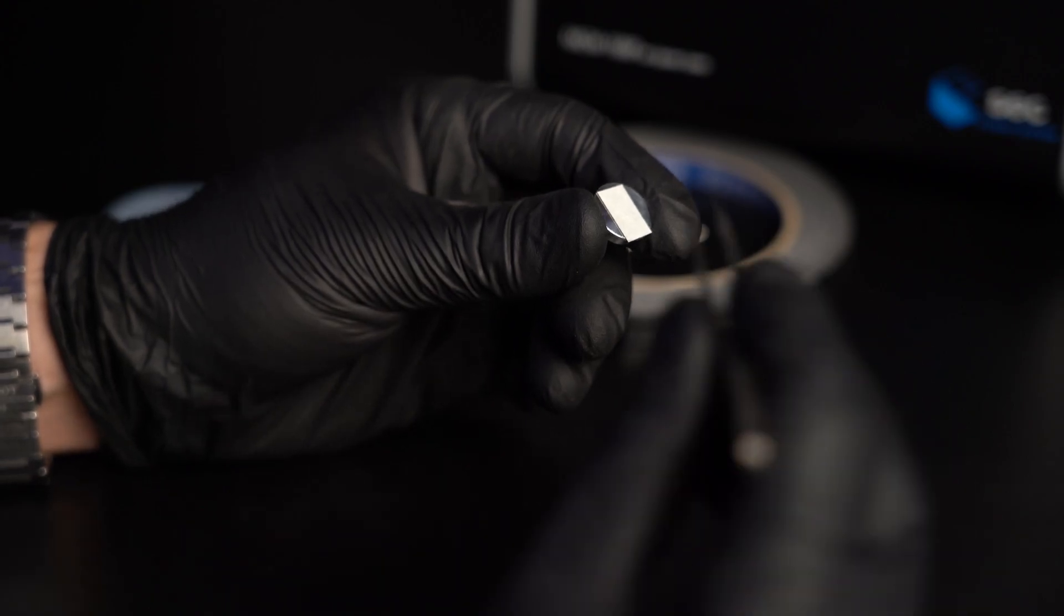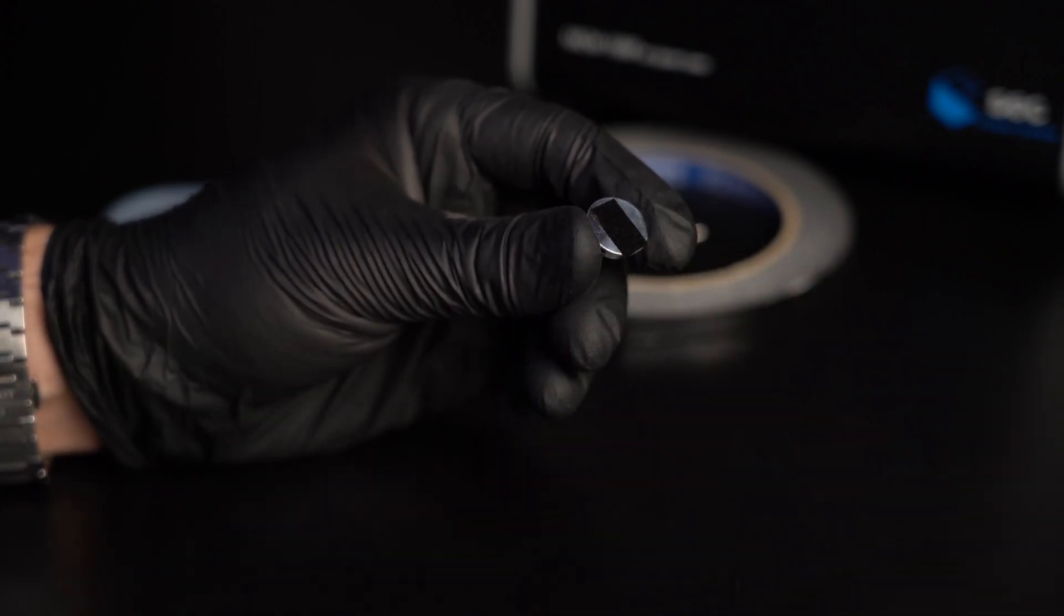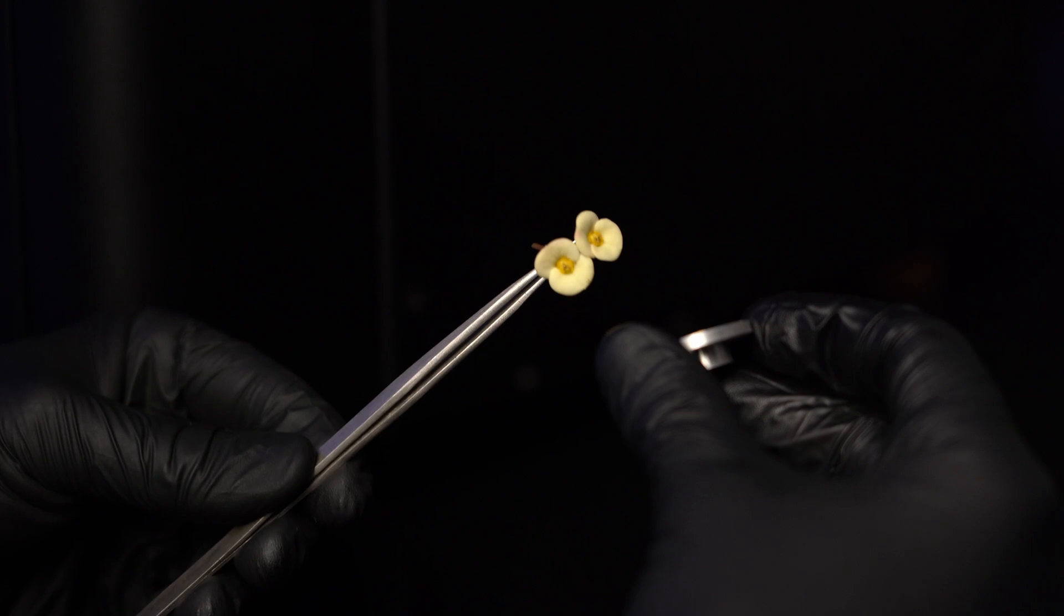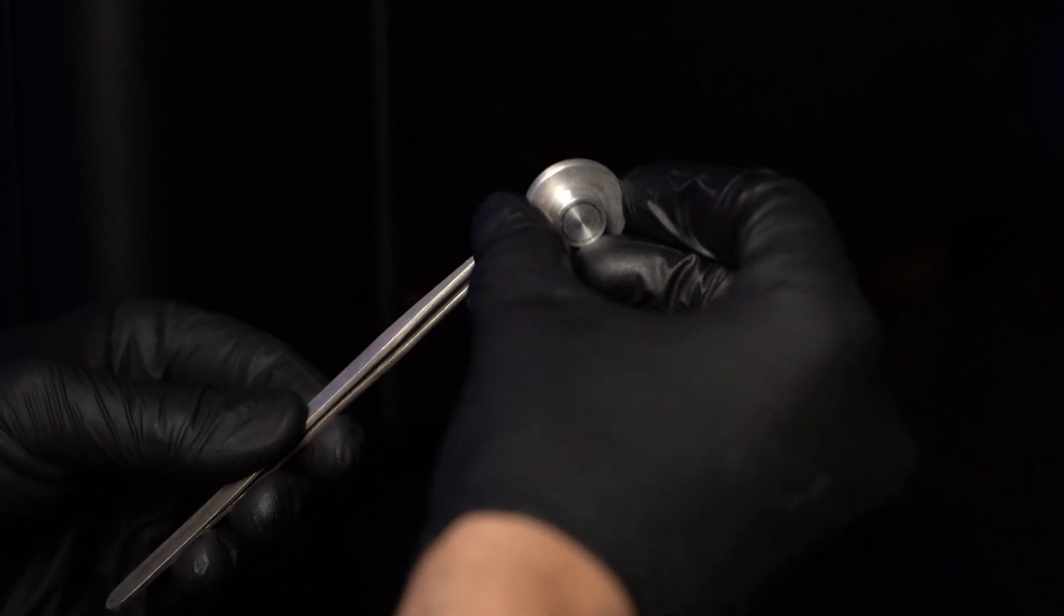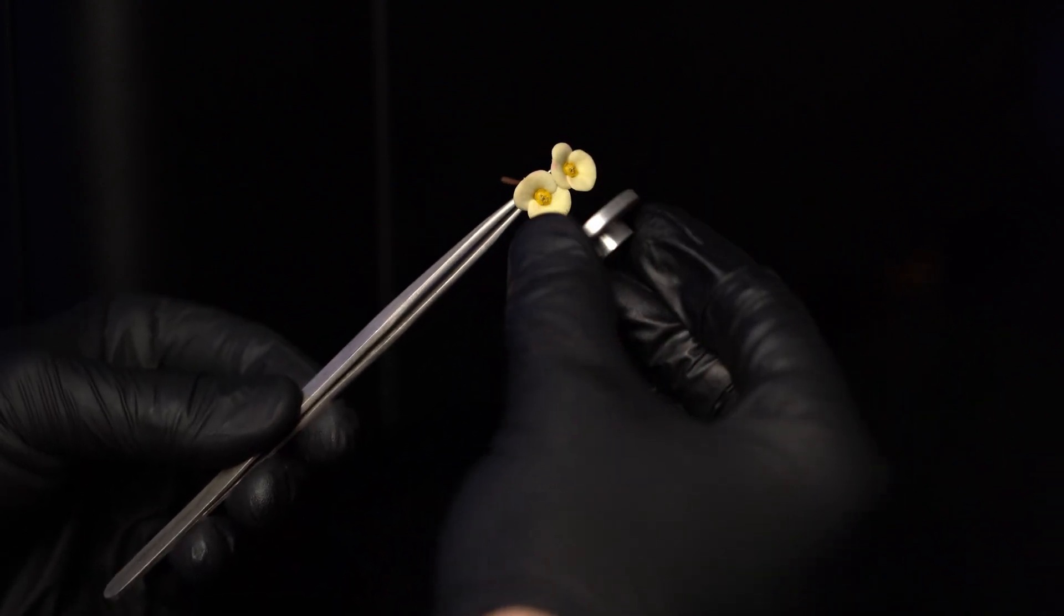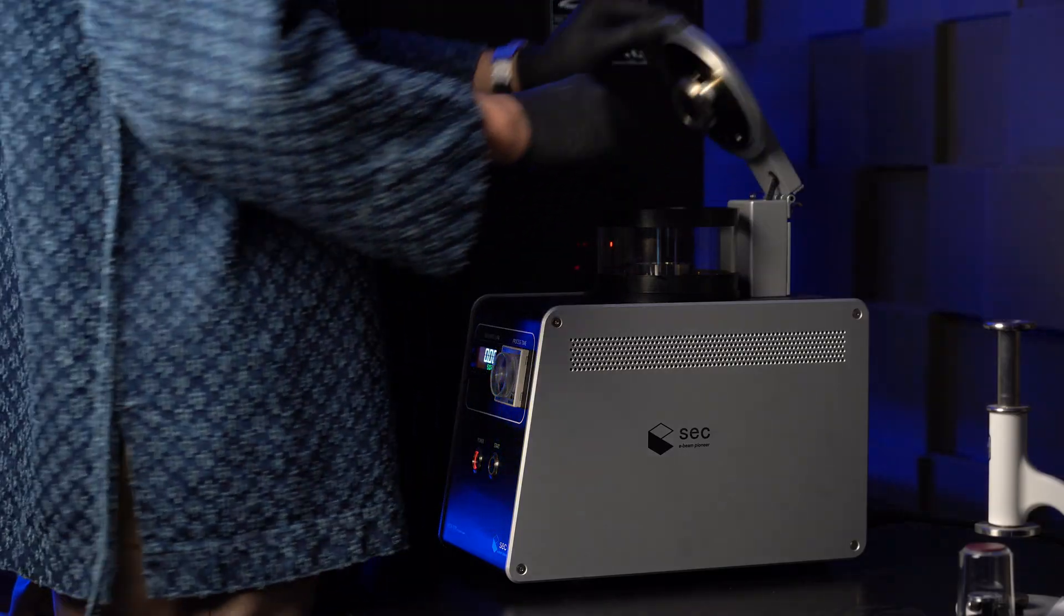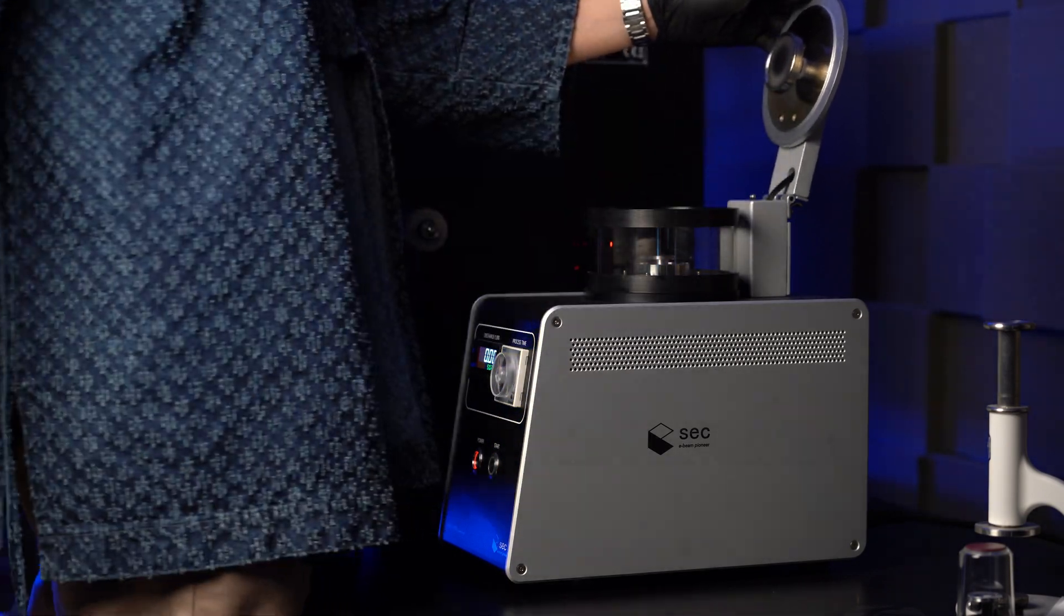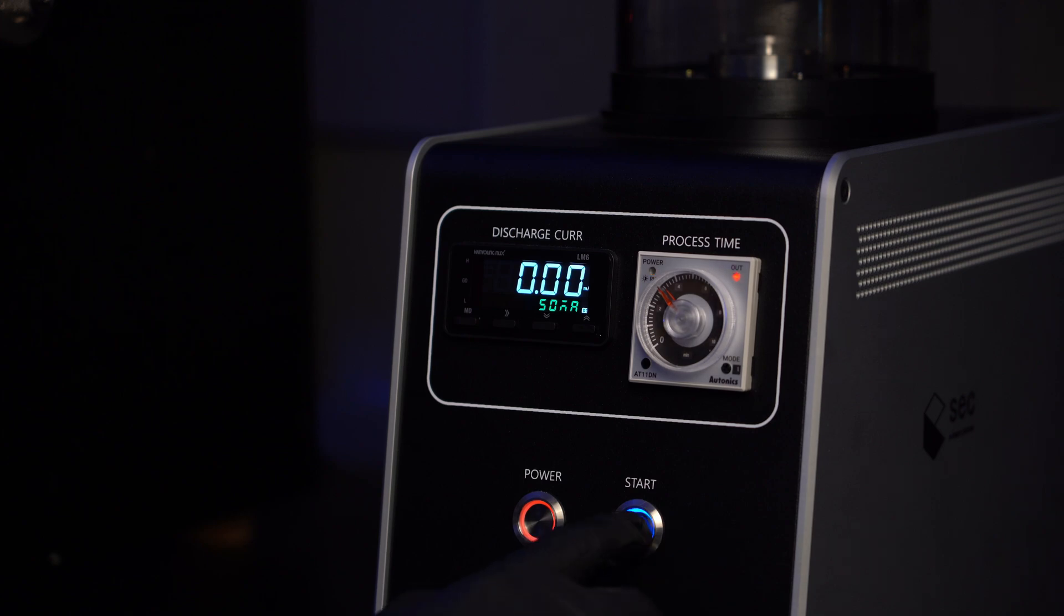I think pollen grains is a perfect sample for a demonstration of this microscope. So let's put some double-sided carbon tape on this tab and try to find something interesting. Pollen is a poor conductor of electricity and will become charged during analysis, so we need to coat it with a thin layer of metal. One and a half minute is more than enough.